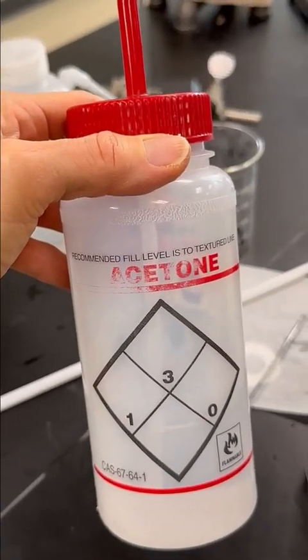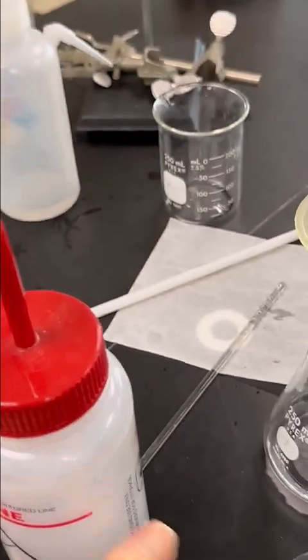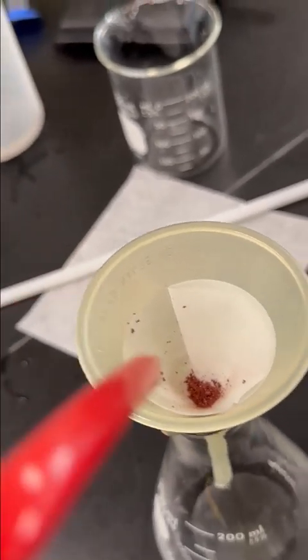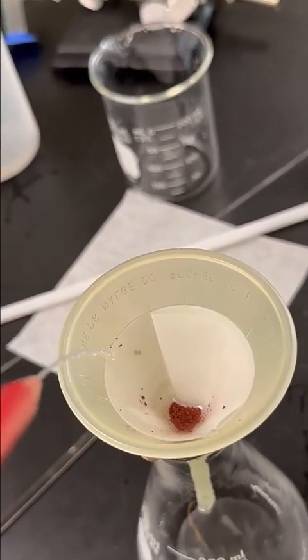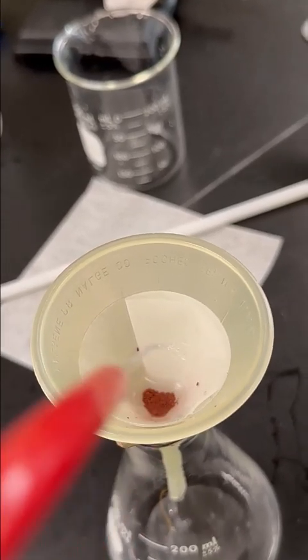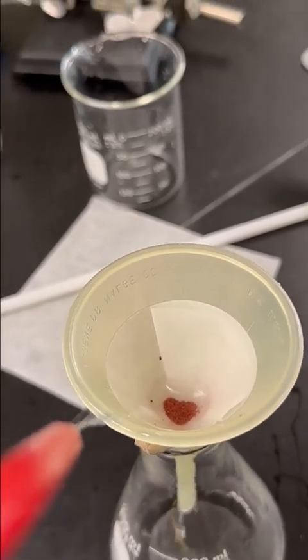All right, so here is my acetone, and we're just going to rinse the copper with some acetone. And I'm just going to try to guide it and get all those little pieces down into the middle of my filter paper and rinse it down there.